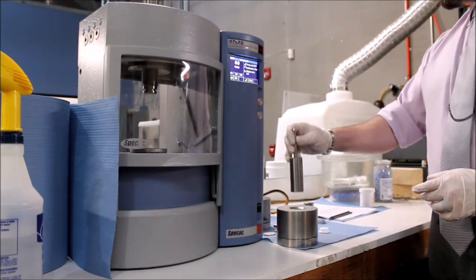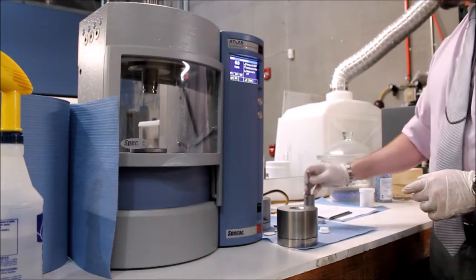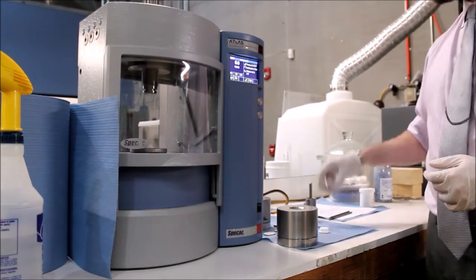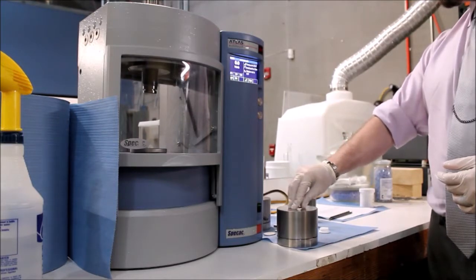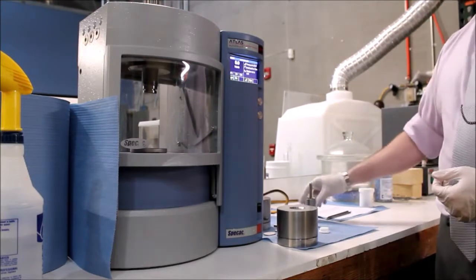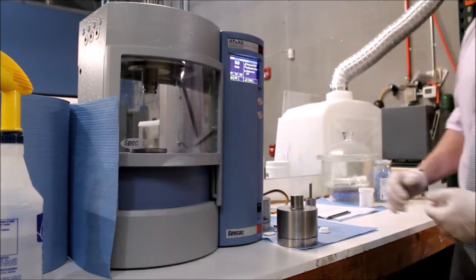Remove the pellet filling tools as seen and insert the second puck into the bore, taking care not to jam it. From there, carefully insert the plunger into the cylinder body.